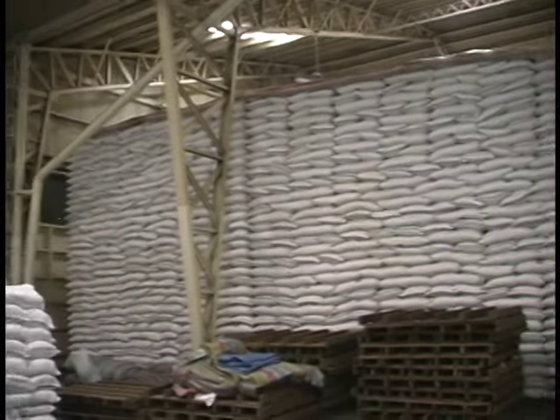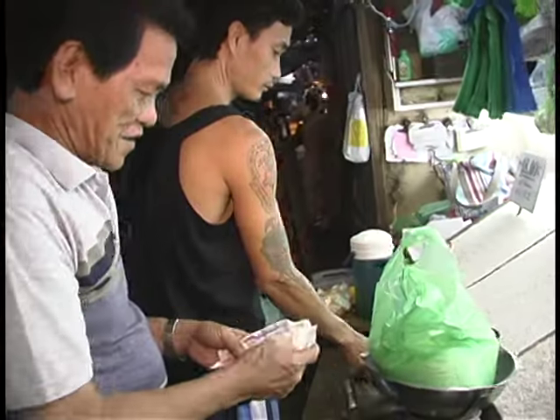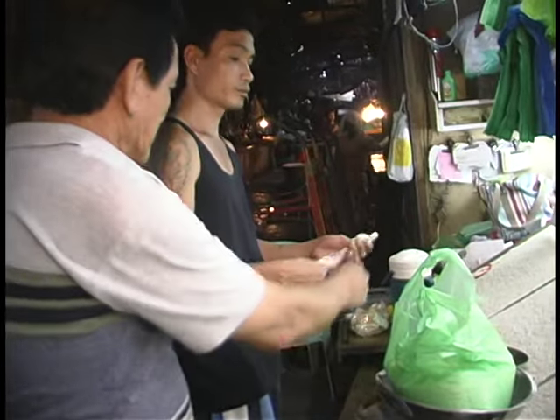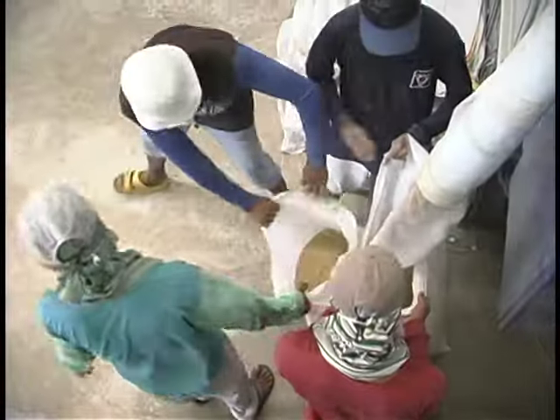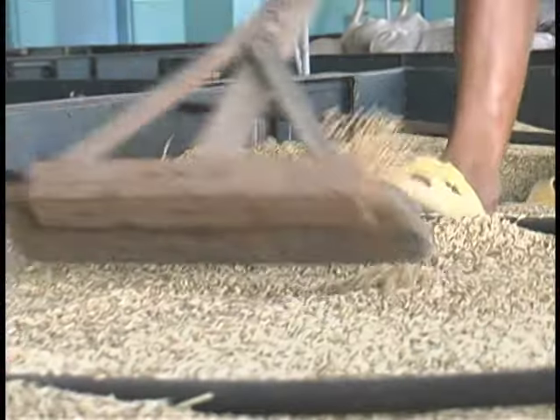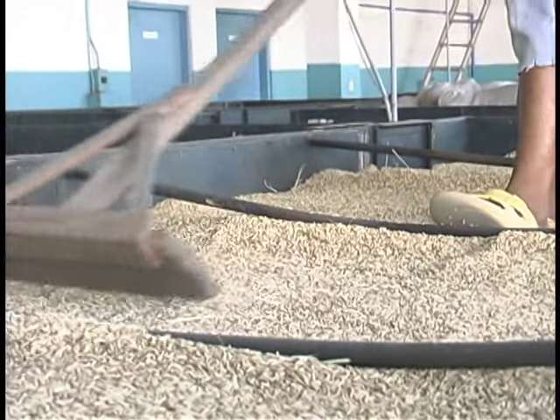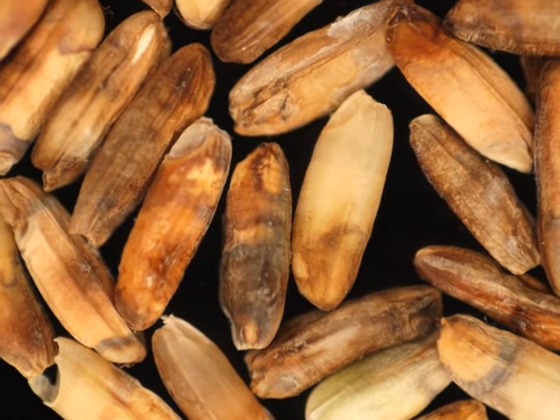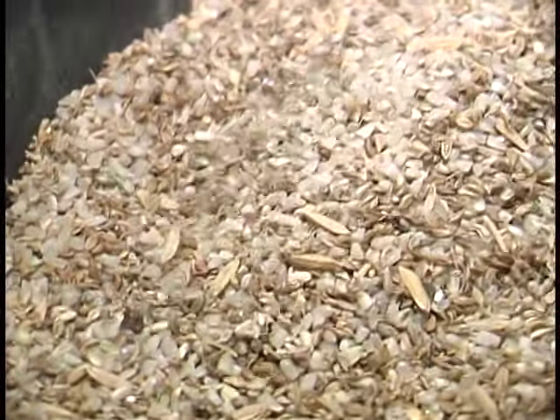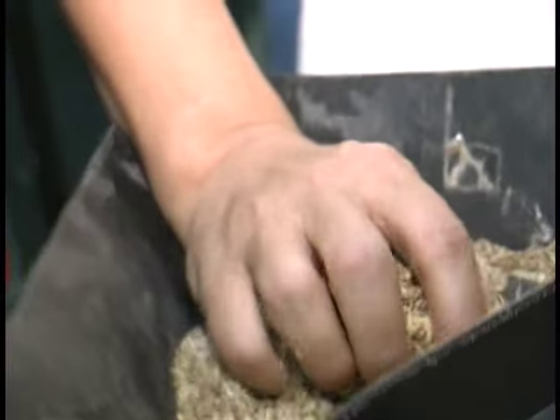To effectively manage and market paddy and rice, it is important to correctly test the moisture content. If you do not test the moisture content properly, an inaccurate result will lead to extra drying costs and harvesting loss if paddy is harvested wetter than necessary. If the grain is too wet in storage, it will spoil. There will be a loss of quality and extra drying costs if paddy is over-dried.